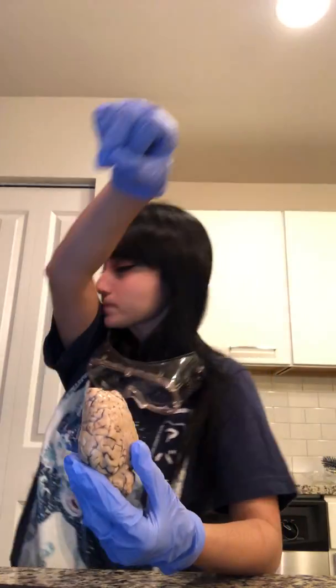As I was mentioning before, we're going to look at a sheep brain and its different aspects. Before we start, I would like to look at the dorsal aspects and identify some of those important structures. Also, I want to show that these are the meninges and they were pulled apart during the dissection. Let's turn our attention back to the dorsal structures.